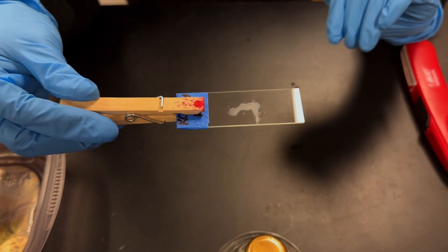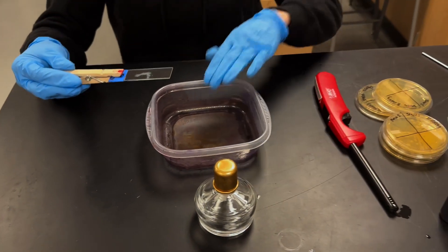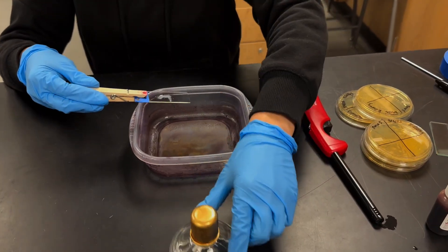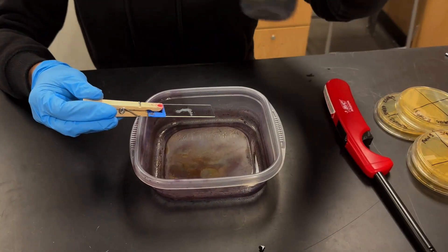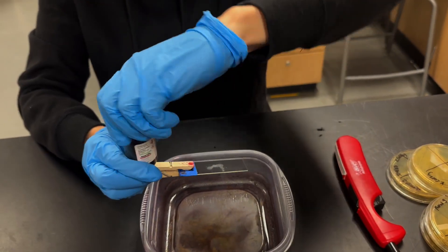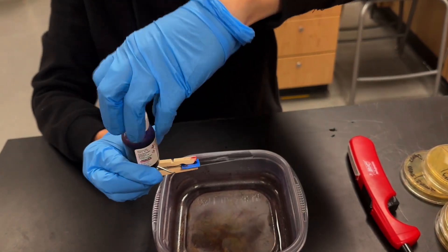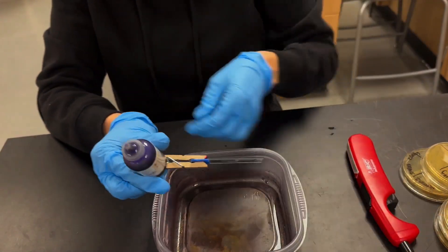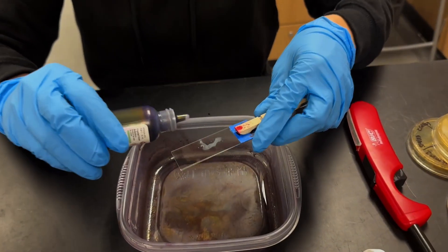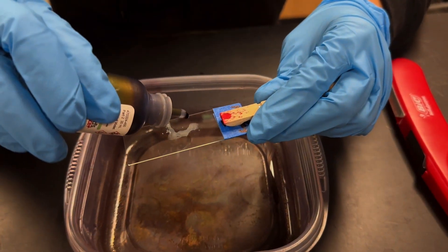All right, we'll move on to the next part and that's going to be our first stain. And so we're going to use this little bucket to stain over and we'll start with our first stain, which is crystal violet. And you're going to drop crystal violet. You'll flood the area. Remember it's on the top of the slide here with crystal violet, two, three, four.